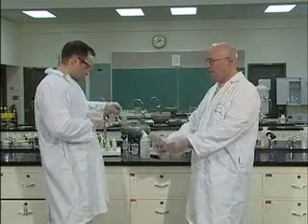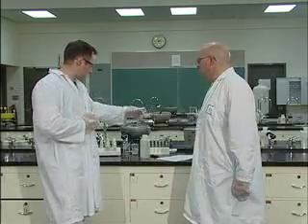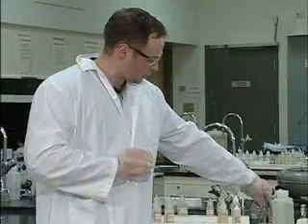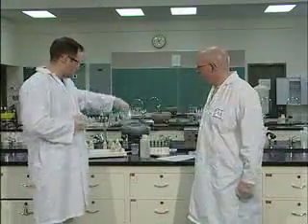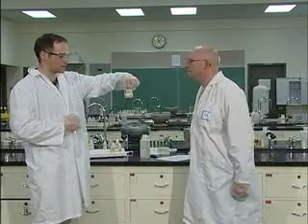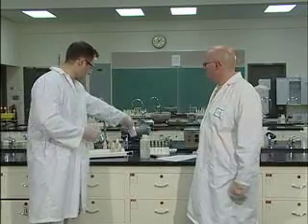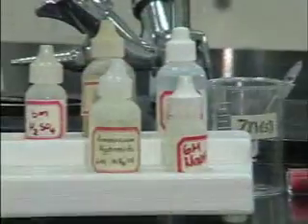So the first one we're doing is a composition reaction. Actually, before we even start, all of the chemicals you will need will be on your tables. You'll also have zinc metal that's already cut to size for you. And magnesium metal, which is already cut to size for you. You'll also notice there's a big caution sign under the magnesium. That's because when you add magnesium to acid, it gets very warm, so be careful with it. So don't add the acid to that beaker here. No, don't do that.